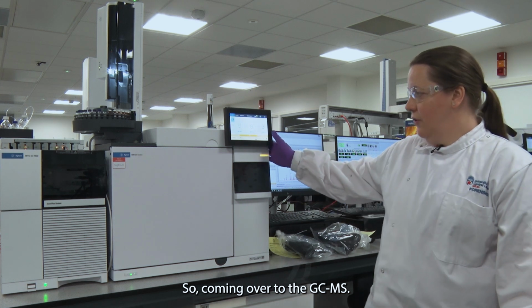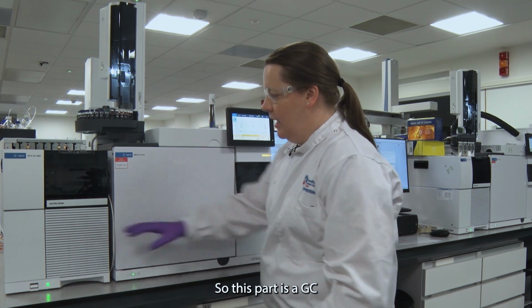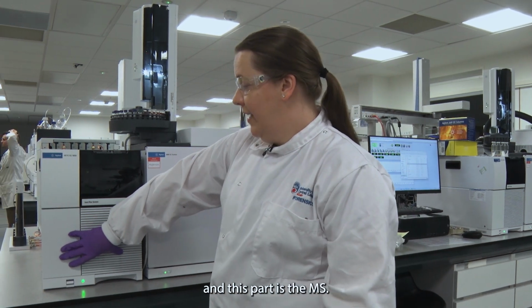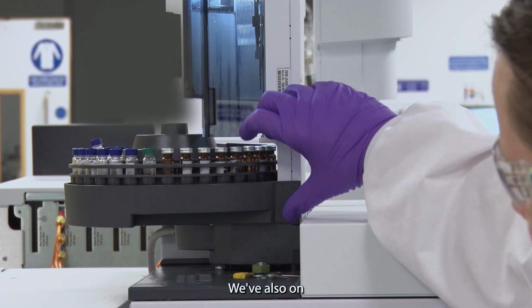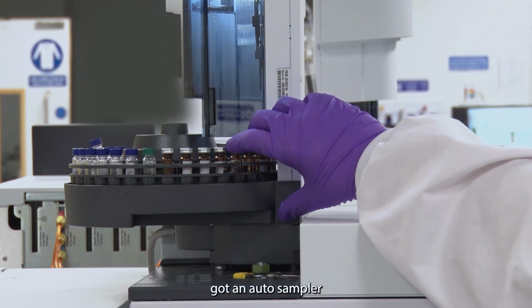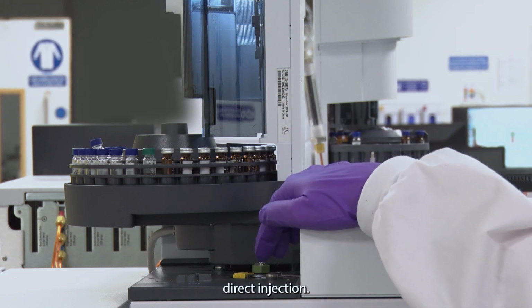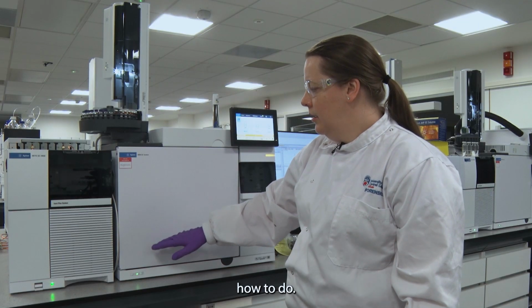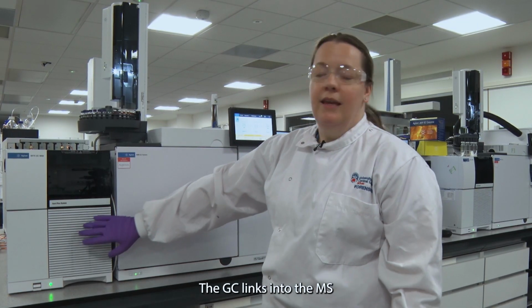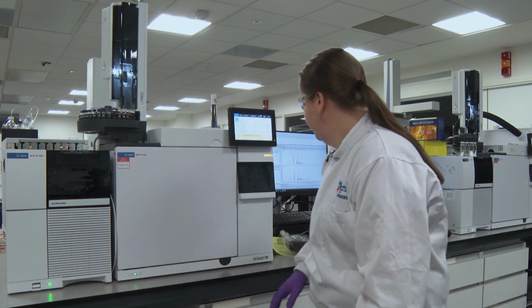So coming over to the GCMS, this part is the GC and this part is the MS, and you've got the injection port for the GC. We've also on this one got an auto sampler, but you're going to be running it in manual mode, so you're going to be doing direct injections. That's what I'm going to show you how to do. And the GC links into the MS for your mass spec analysis.